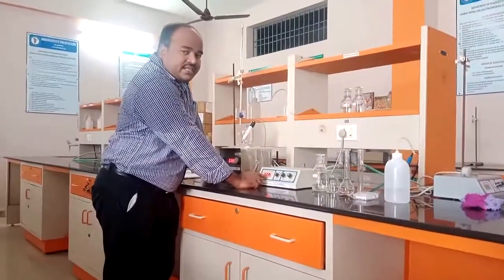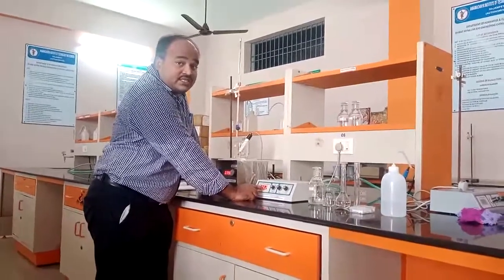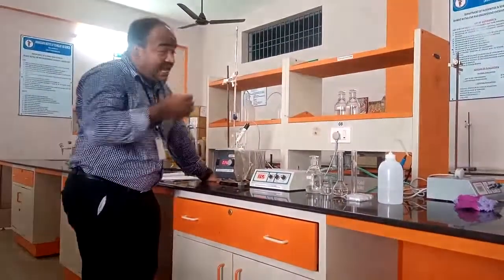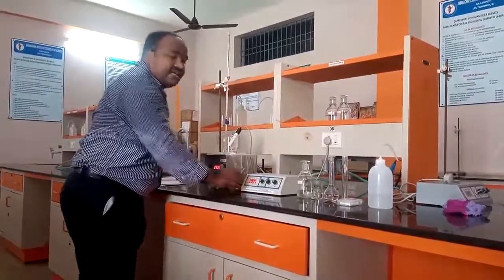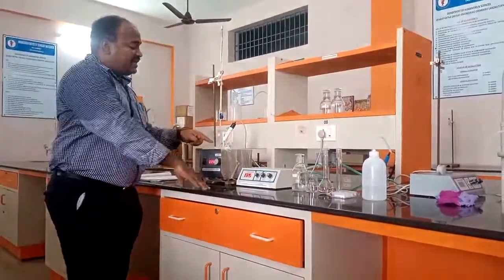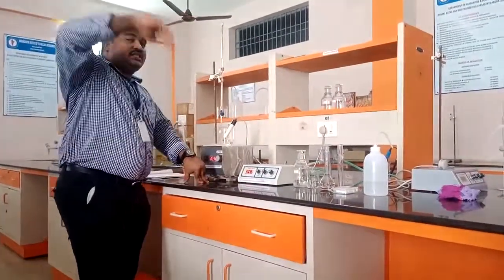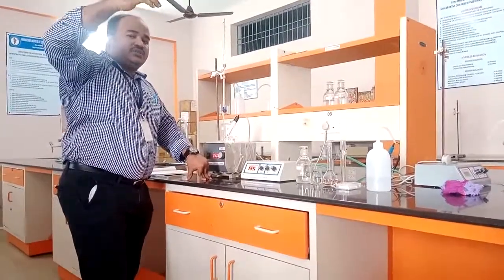Our initial point is 7.1. So now it is 5.2. So now completely acid mixture is neutralized. So we need to do this experiment until we get the equivalence point of 7. When it is the initial conductance of acid mixture, then what is the conductance which is reached to the conductance of complete neutralization of the acid mixture?